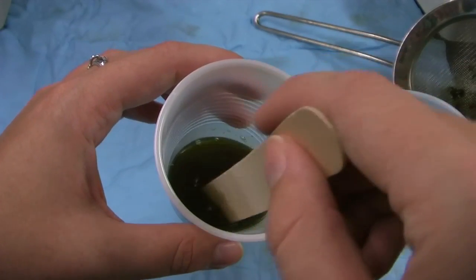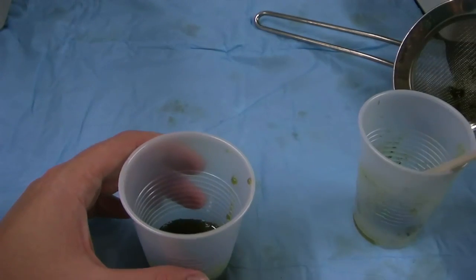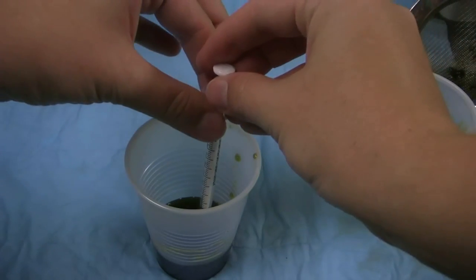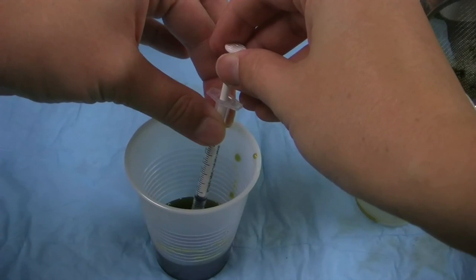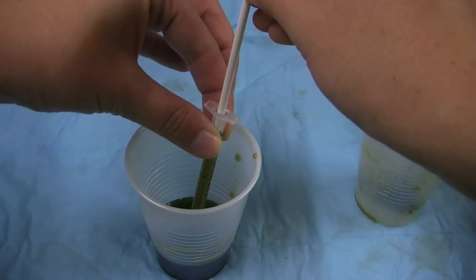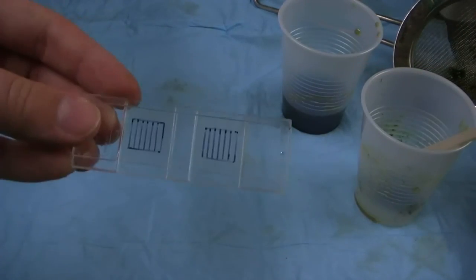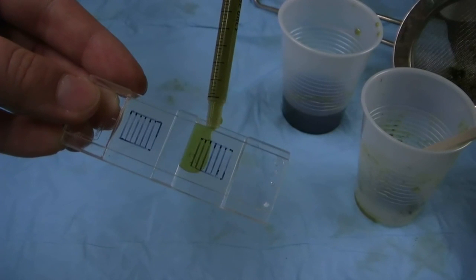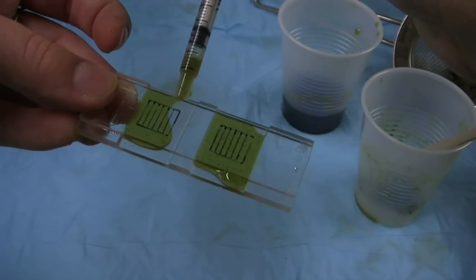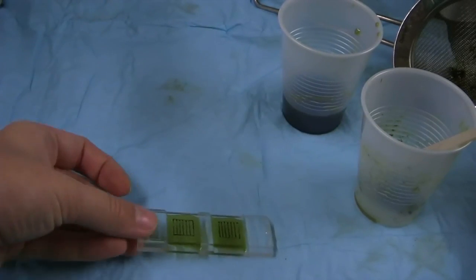Once the mixture is strained, stir the remaining solution with a back and forth motion eight times. It is very important to do it exactly eight times. The next step is to fill the 1cc syringe or disposable pipette. We prefer to use 1cc syringes because they are easy to clean and reuse, while the pipette can only be used once and can be more expensive. Holding the McMaster slide at an uphill angle towards your body, quickly press the contents of the pipette into one of the chambers. A quick, steady flow will prevent air bubbles from forming, as these can be mistaken for eggs or inhibit viewing. Repeat to fill the second chamber.